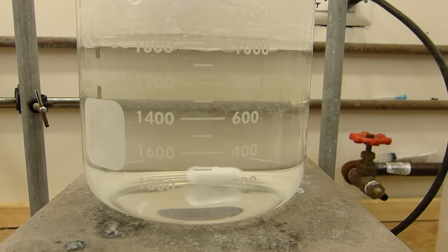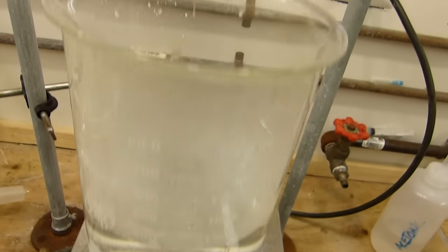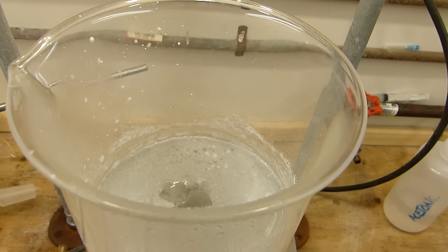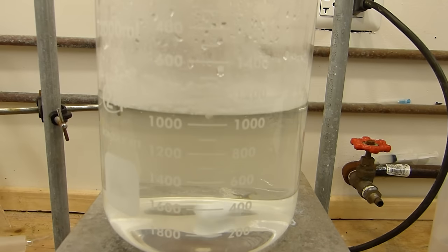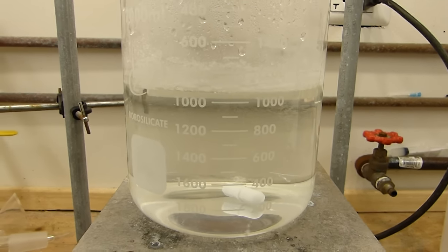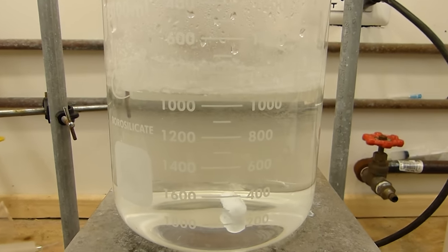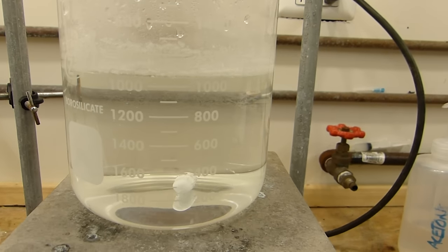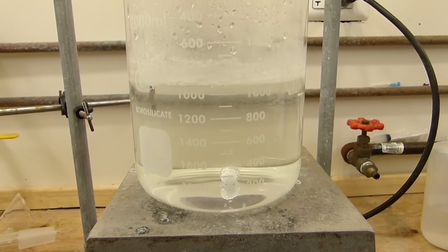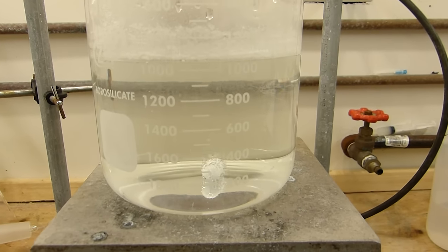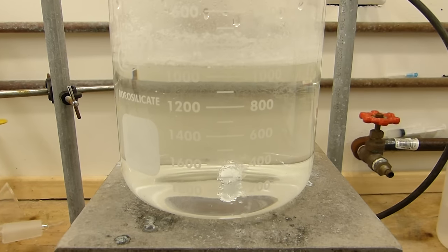All right, well, all the benzoic acid appears to have dissolved, except for this little crust on top, which just forms no matter what you do when you have saturated solutions at high temperatures like this. So I can go ahead and turn off the stirring. I'm going to use a magnet to retrieve my stir bar, and then I'm going to go ahead and let this cool down. Turn this off, let this cool down, and the benzoic acid should crystallize, and then we can collect the newly purified benzoic acid.